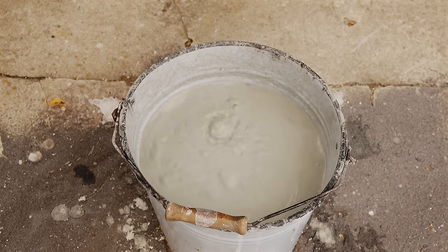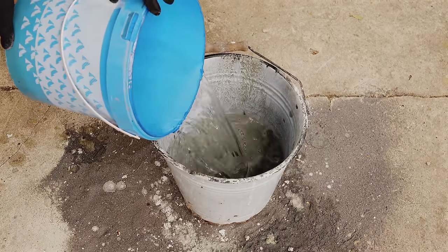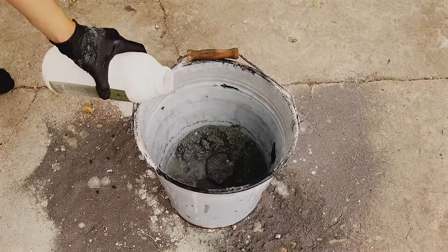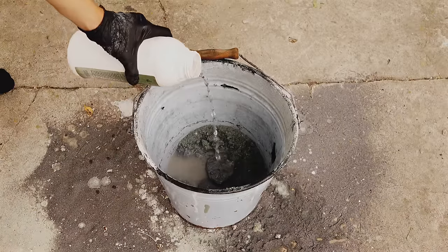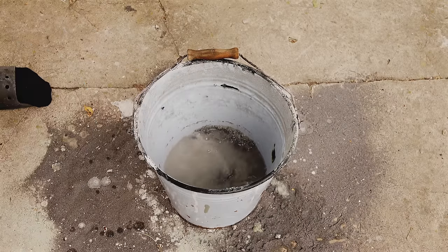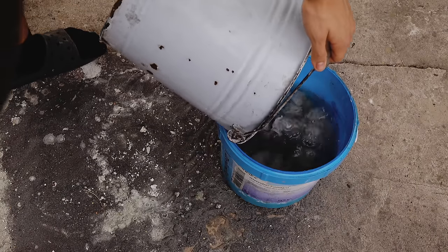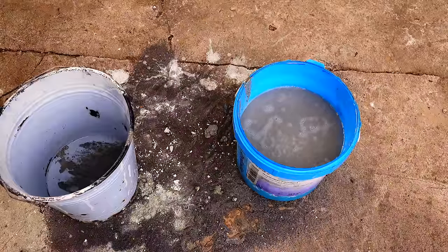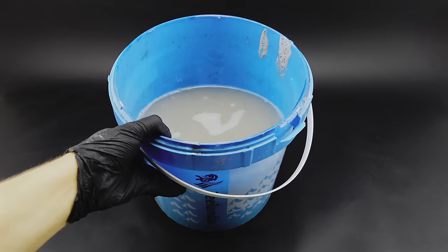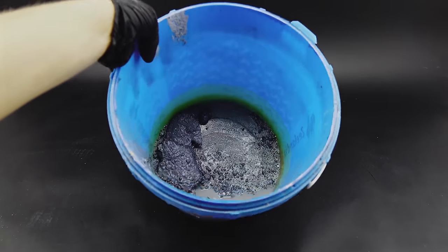When everything calmed down, I poured away most of the now very dirty water, and washed the remaining sludge with some more water. I repeated this process a few times, and then poured in some concentrated hydrochloric acid to destroy any remaining aluminum sulfide. I then diluted the acid down with even more water and transferred it into a plastic bucket, since the acid would damage the metal one, and left this mixture to react overnight. When I came back in the morning, I brought the now much less stinky bucket into my lab, and got rid of all the dirty acid water to reveal a ton of nice silicon blobs.